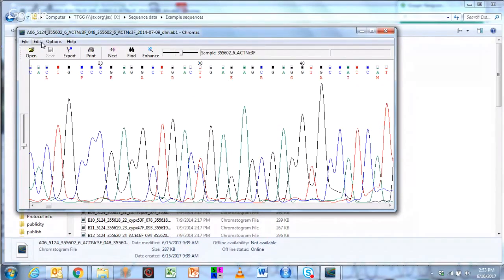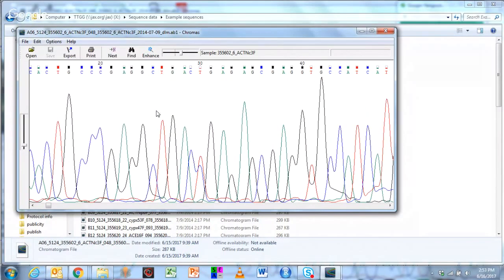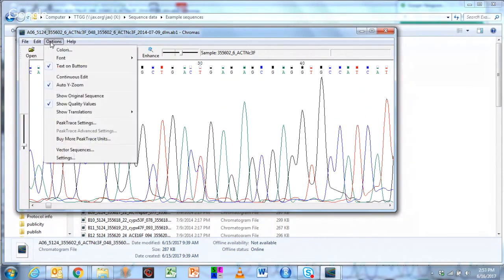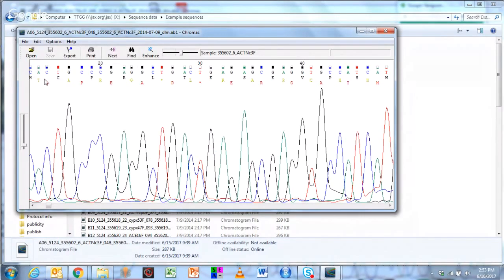So I've already done an option here where I'm showing the translation. Let me go back. This is the default view. Under options, you can say I want to see the translations. And if you don't know what frame it's in, whether it starts on the first, second, or third, you can hit 3 lines. The top will be starting on the first base called, then starting on the second base called, and starting on the third base called.